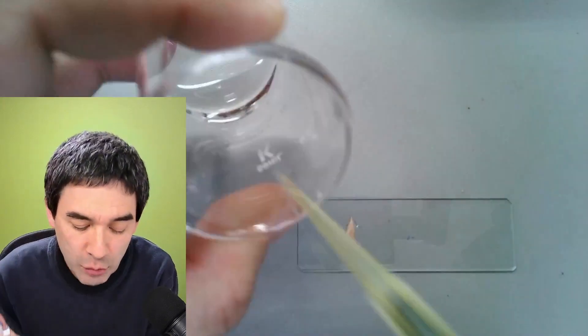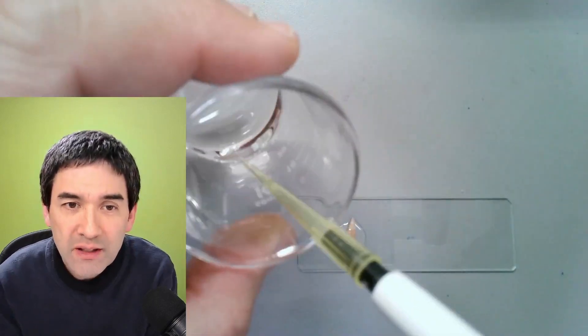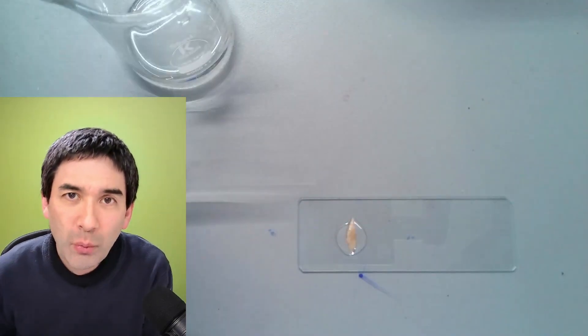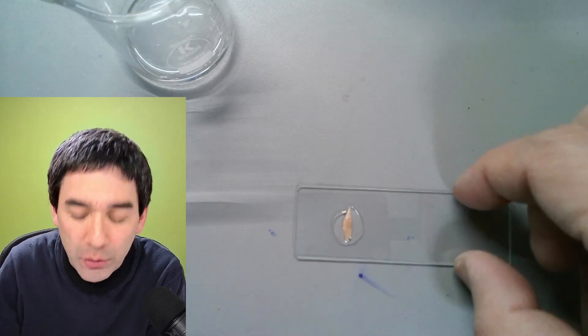And then I add a small drop on top because I wanted to make sure that it's really nicely covered. You can see that essentially the oil really likes to cover everything and usually there are very few bubbles, if any at all.